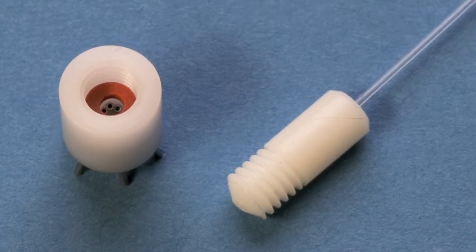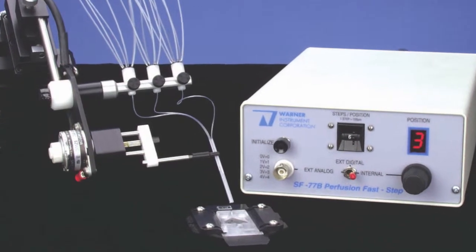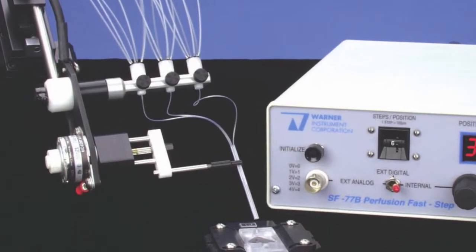The MM series manifolds are an integral part of the SF77B perfusion fast step system.